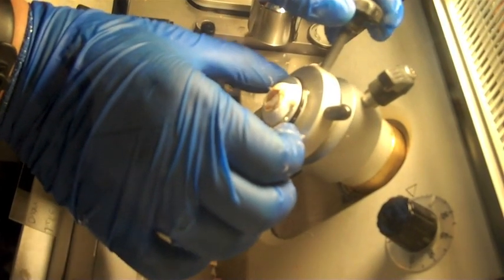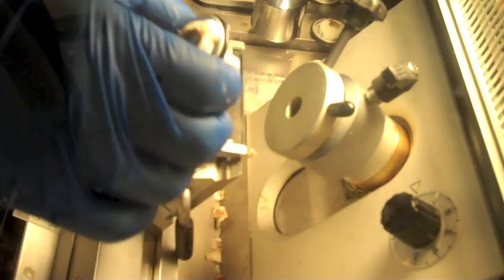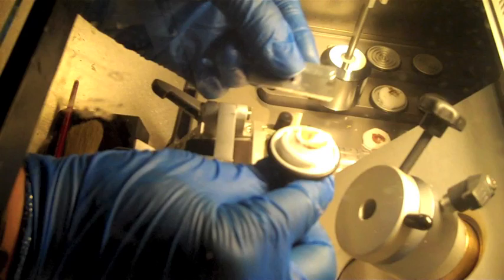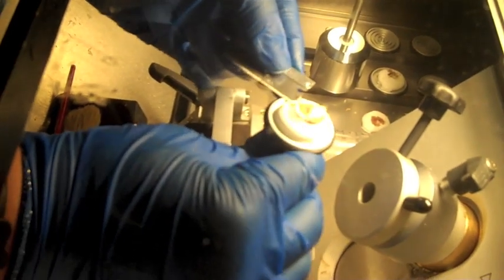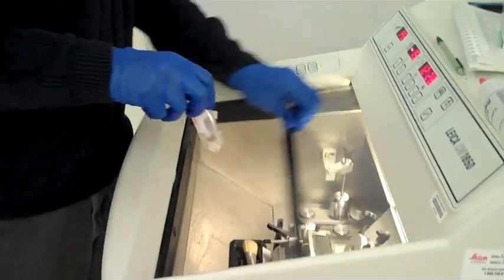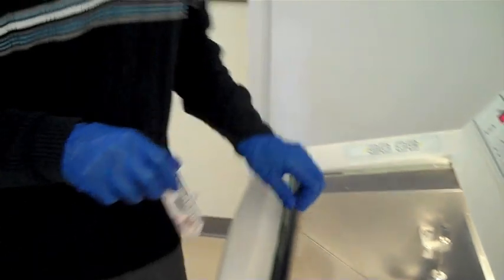When you are finished sectioning your tissue, remove the chuck from the specimen holder. Use a razor blade to remove the specimen from the chuck. Place the specimen back in the tube. Return the tube to the freezer in the prep room.